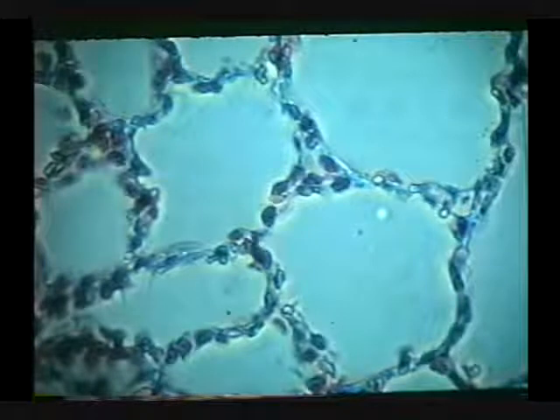There's our respiratory membrane, and I think that's a macrophage, that's probably a type 2 cell, and there's another macrophage down there. These are beautiful examples of alveoli within the lung. There are several type 2 cells per alveolus — remember, this is a two-dimensional cut of three-dimensional spherical structures. Isn't that pretty?